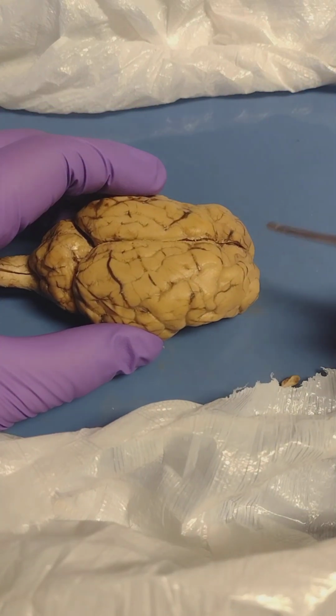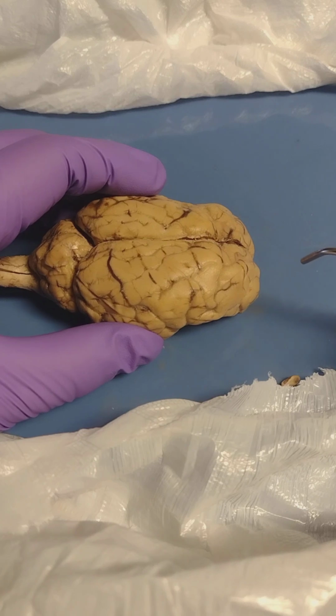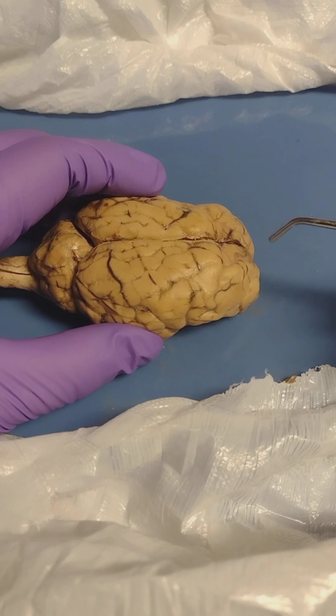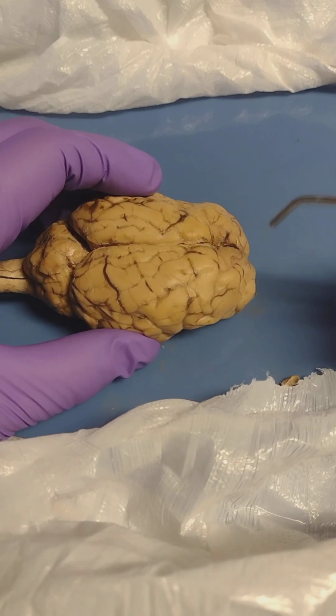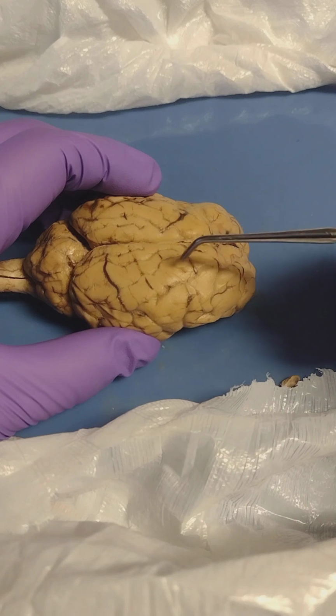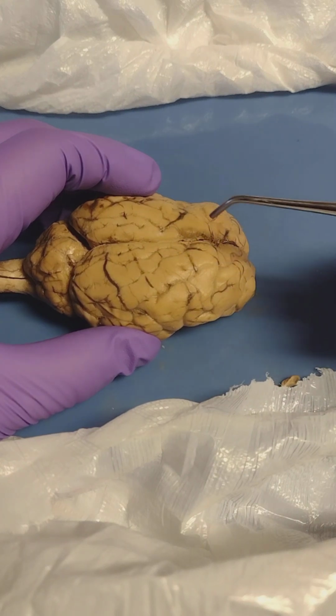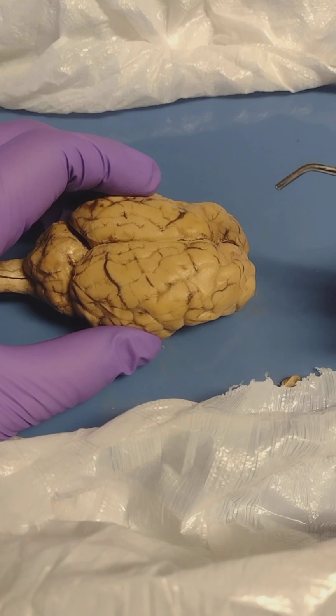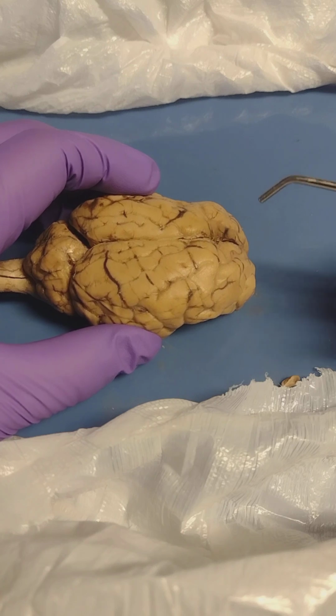The frontal lobe is mainly used for higher cognitive functions, like decision-making and problem-solving. It is home of the primary motor cortex that coordinates voluntary movement. You will also find Broca's area here, which helps with language production. And the parietal lobe, as I discussed earlier, is behind the frontal. It processes sensory information and helps with awareness and coordination. The primary somatic sensory cortex is here, which maps sensory input from the body.